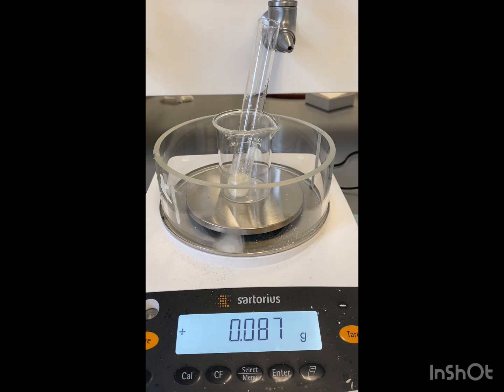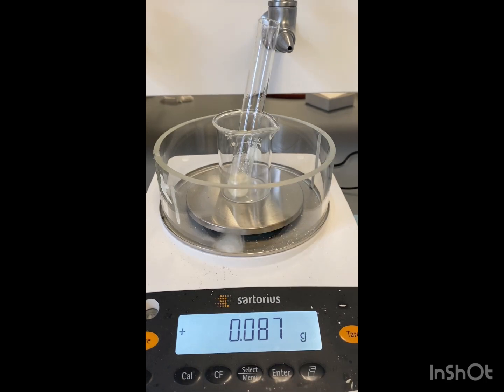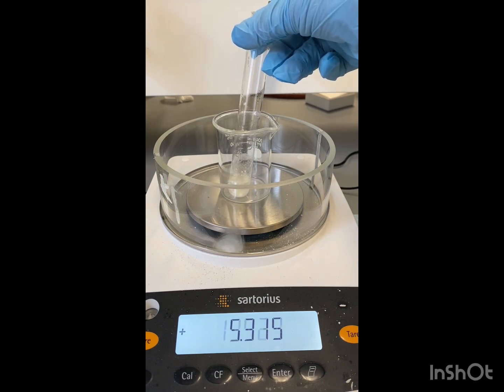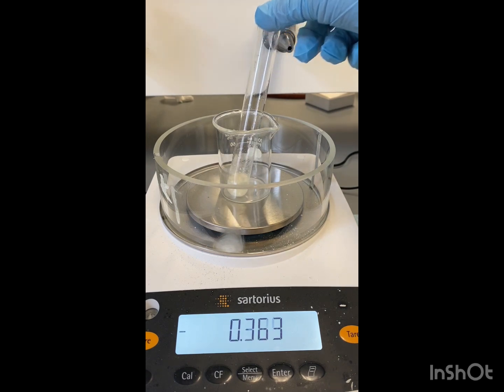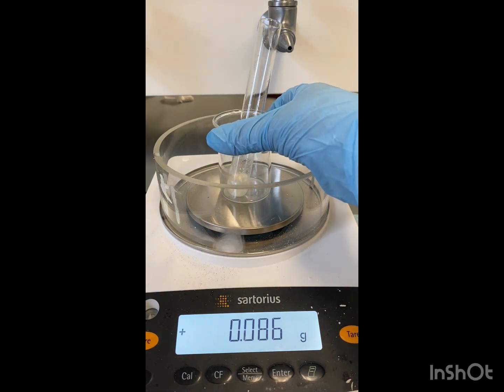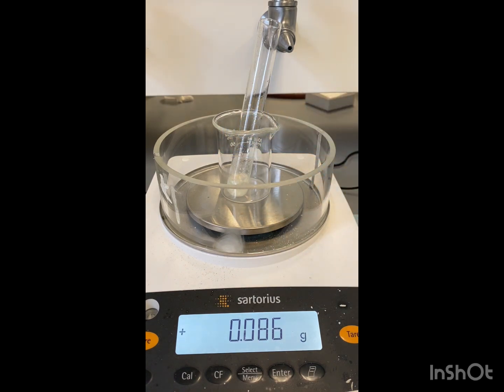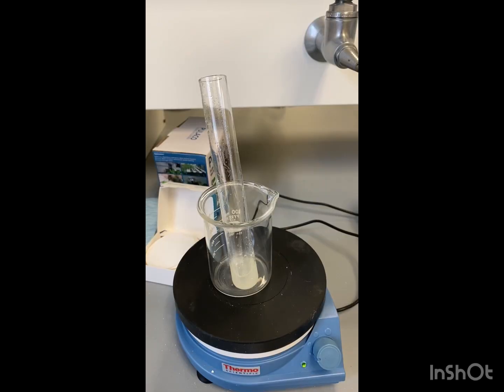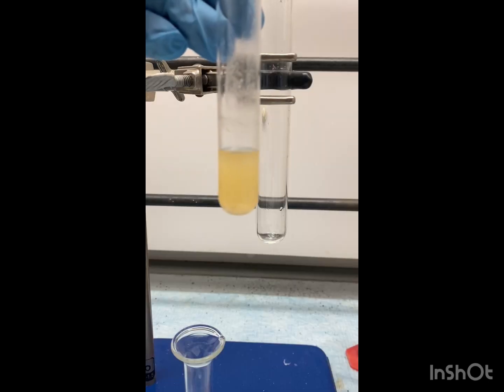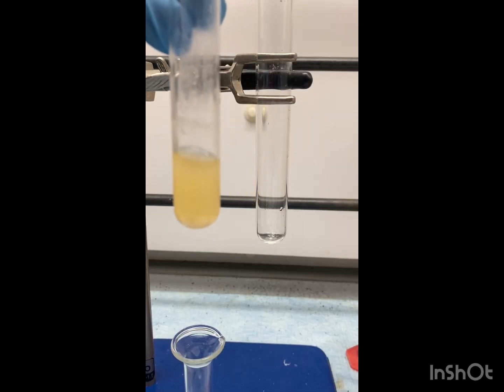Now that they are all mixed in our test tube, we are going to put it on a stir plate and let it stir for about 15 minutes at room temperature. Now that our solution has been stirring for 15 minutes, we are going to work it up.